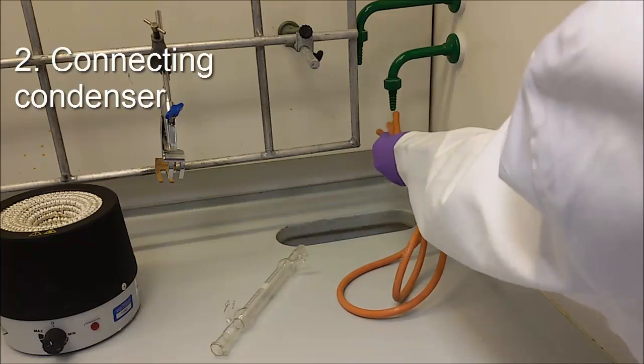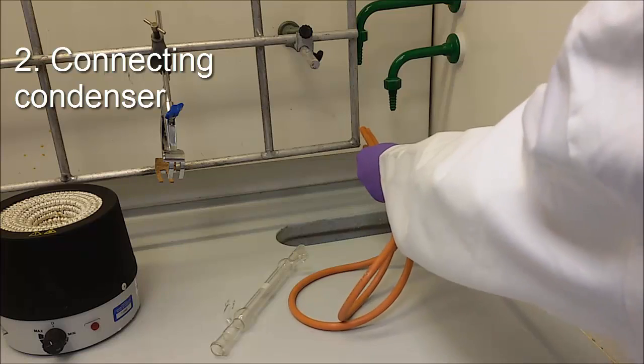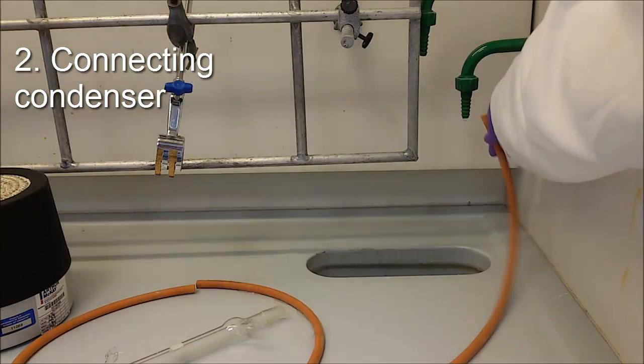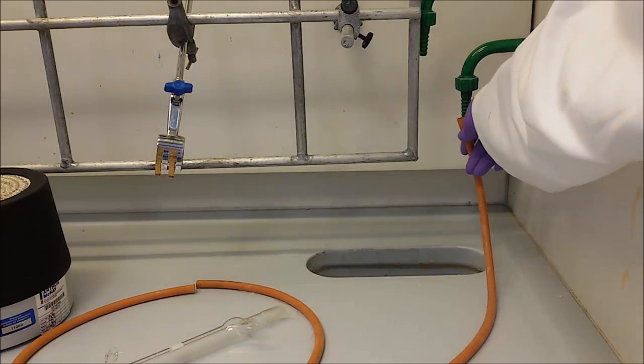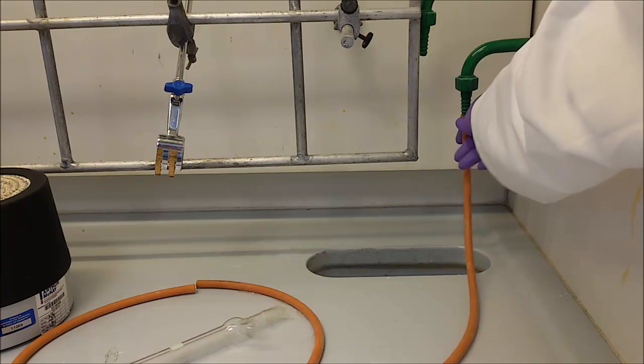Now take two pieces of thin tubing and moisturize the ends with water. This makes the tubing easier to be attached. The order of attaching the tubing is important.